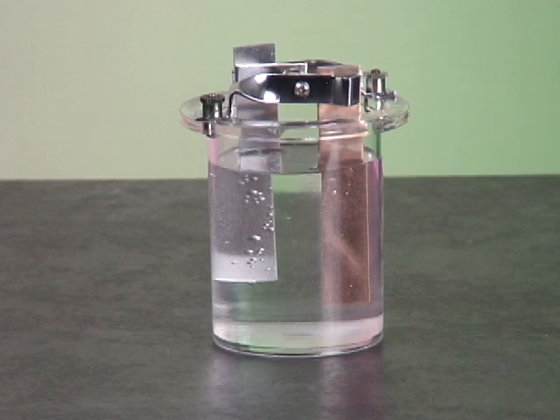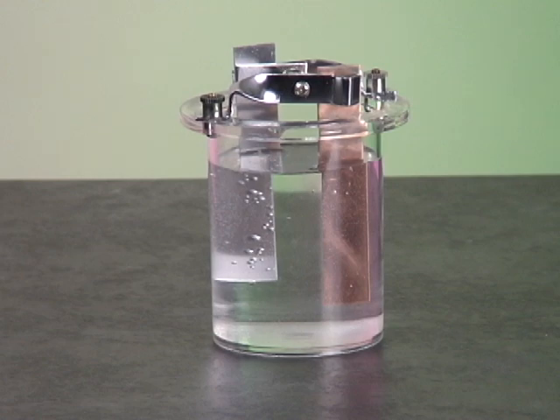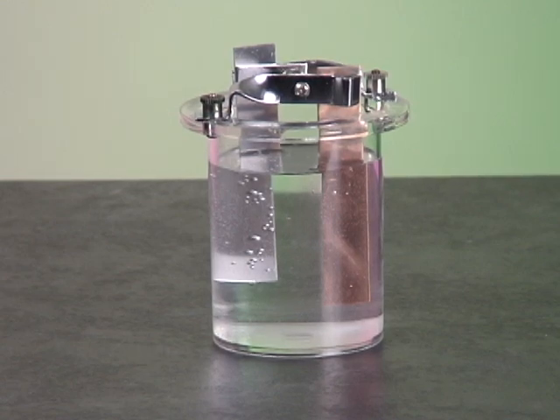The positive zinc ions repel positively charged hydrogen ions toward the copper plate. The hydrogen ions acquire electrons from this plate and form hydrogen gas. Students can see the gas bubbles being formed on the copper.